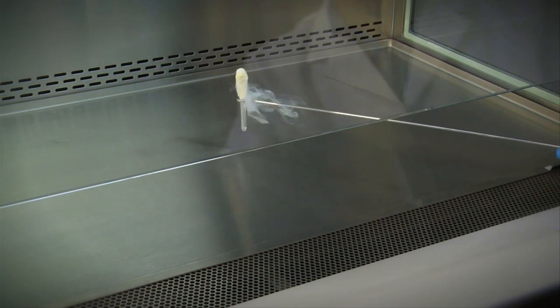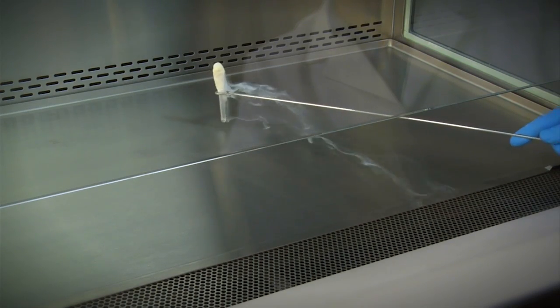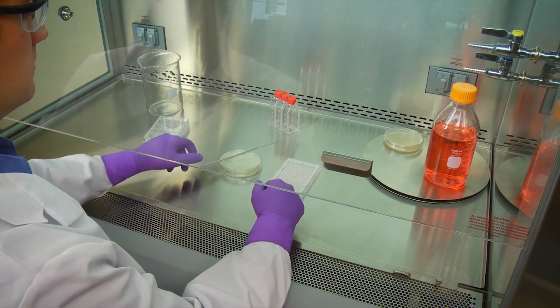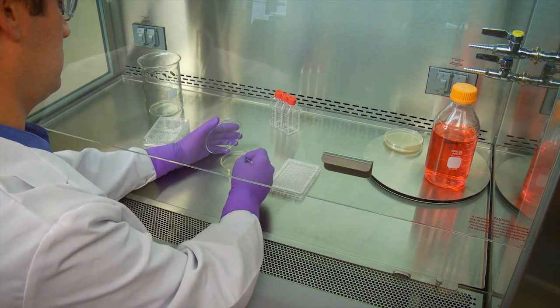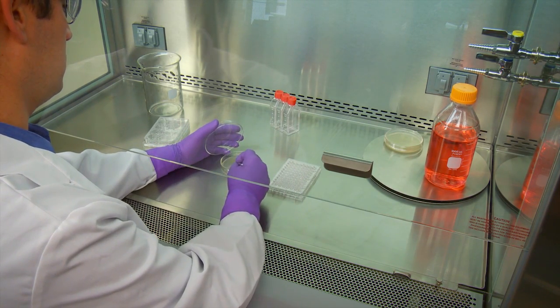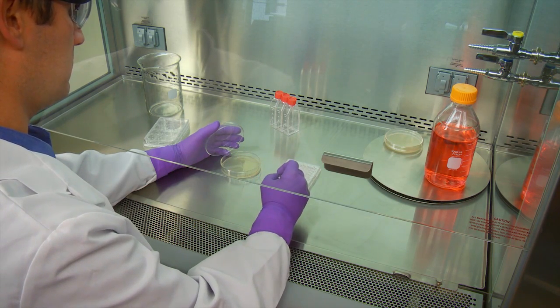Similarly, aerosol generating equipment should be placed toward the rear of the cabinet to take advantage of the air split. It's important to wait for at least one minute before working with material inside the cabinet, allowing the cabinet to stabilize and air sweep the hands and arms, removing contaminants.